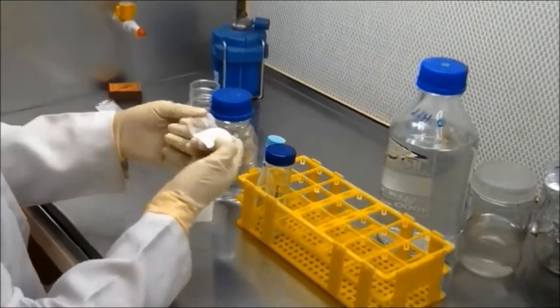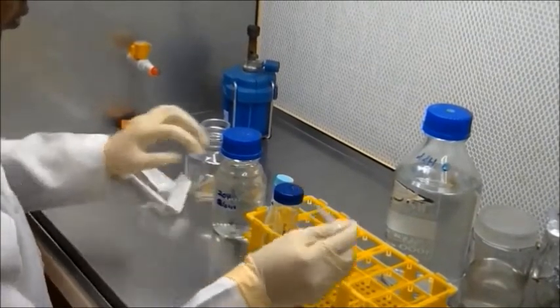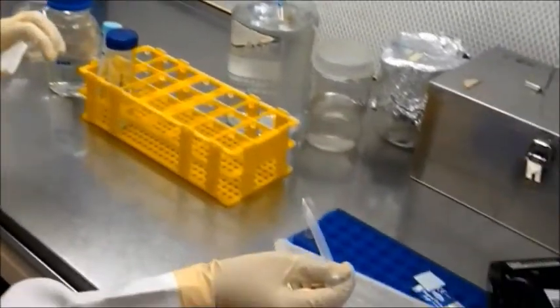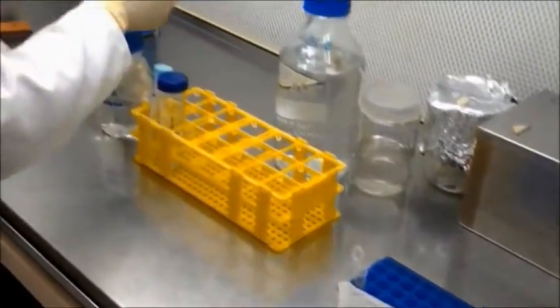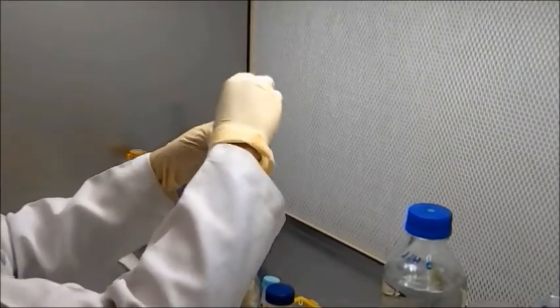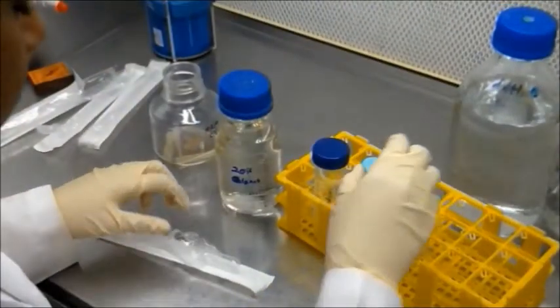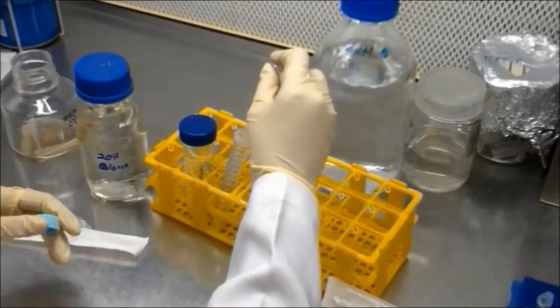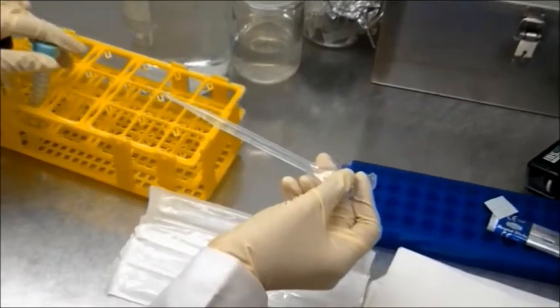The seeds are soaked for 2 minutes by shaking the Eppendorf tubes. The ethanol is then decanted and 1 ml of 20% Clorox bleach and 1 drop of Tween 20 is added, and the seeds are soaked for 10 minutes. After 10 minutes, the seeds are rinsed at least 5 times with distilled water to ensure they are clean and no detergent remains. After letting the seeds dry for a few minutes, 3 seeds are inoculated into a bottle containing half MSO. This procedure is repeated for a second bottle of half MSO.